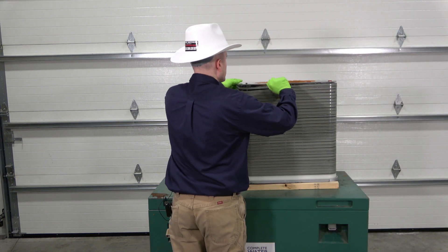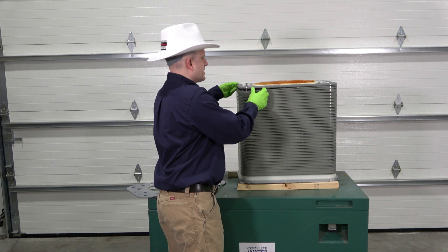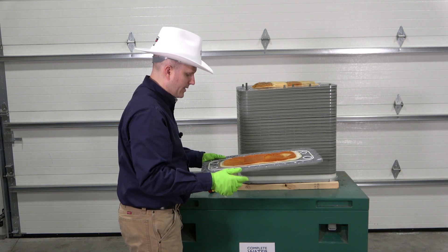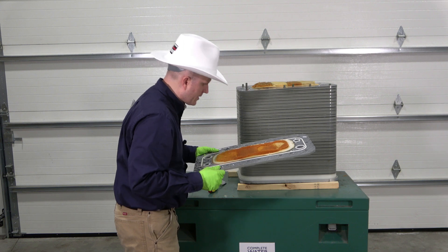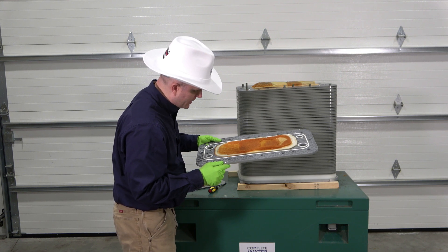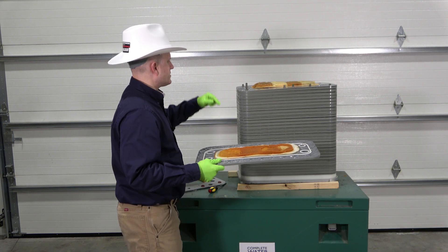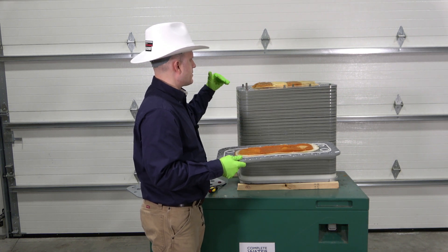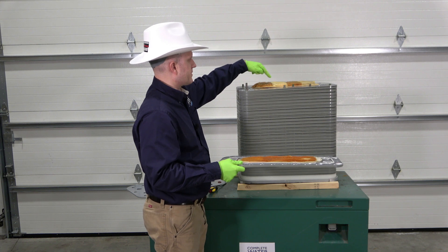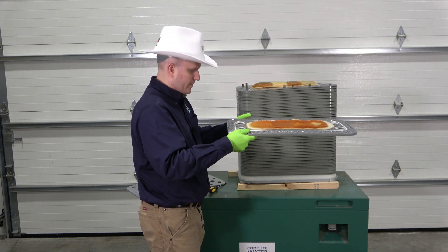Next we've got another plate here and it looks like it's just a spacer plate with some gaskets on it. And here we go — more resin. We've talked about it having cation and anion resin, and it almost looks like either cation or potentially even mixed resin in here. Then there looks to be some sort of membrane or cloth material as the next layer below. It looks like we have mixed bed here but it's separated — cation, anion, cation, anion — which is interesting. And we've got gaskets to keep our water flow correct.